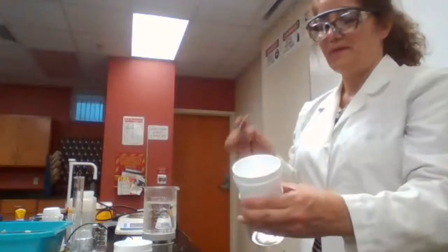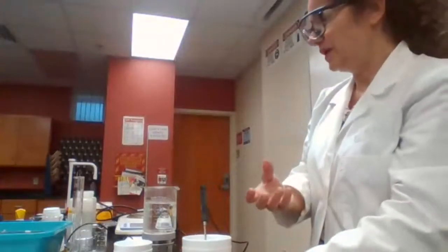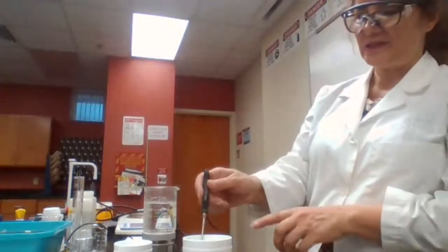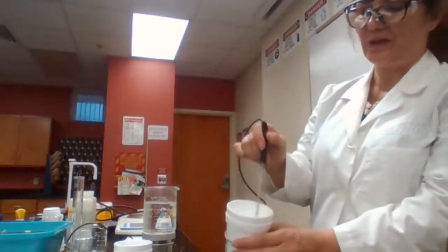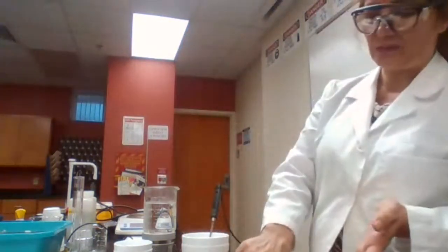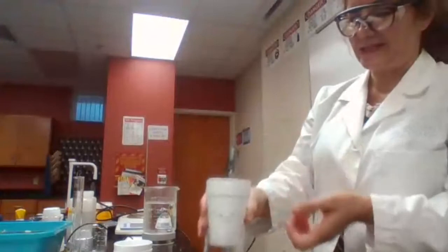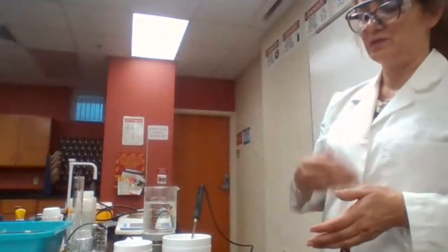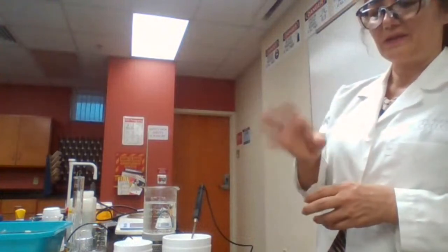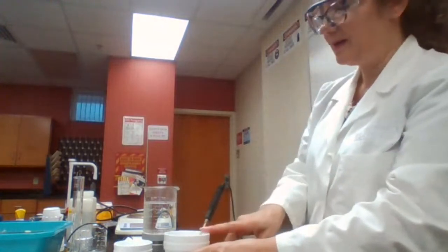So the styrofoam cup with this thermometer is going to act as a calorimeter. And what we are using the calorimeter for, we want to see how much heat is being released. And since that heat is going to increase the temperature of the water that is in this styrofoam cup, we don't want it to be released out. So that's why we cannot use a glass container, because glass is not a good insulator. The heat can be released to the environment quickly, just like a glass cup. It gets very hot or burns your hand if you put hot coffee in a glass cup. So we keep that in a calorimeter.